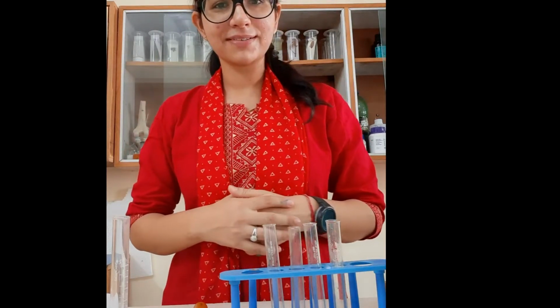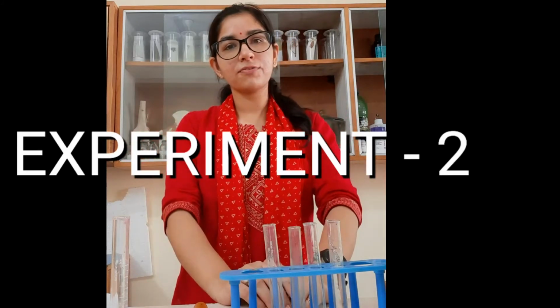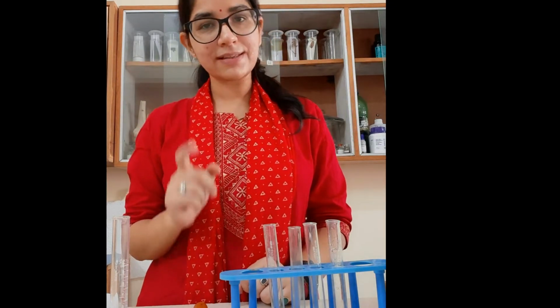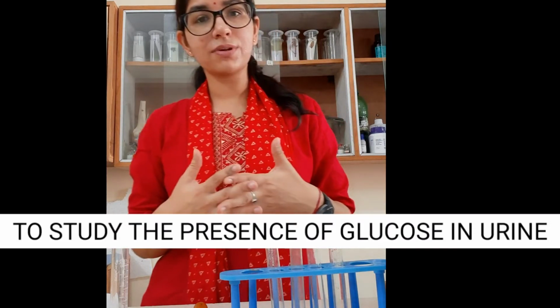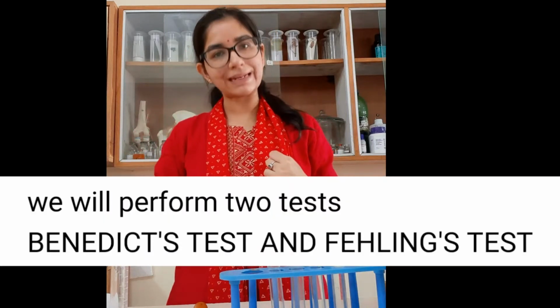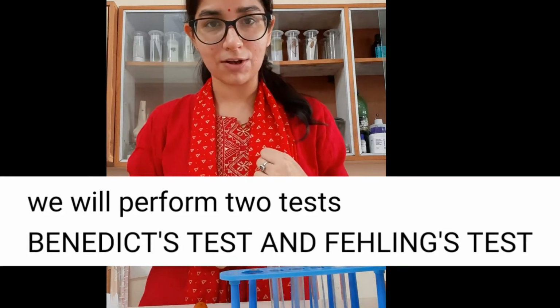So today we are going to perform our second experiment, and the aim of our experiment is to study the presence of glucose in the urine, right? And to find out the presence of glucose in urine, two tests are performed. One we do the Benedict's test and one we do the test with Fehling's solution.